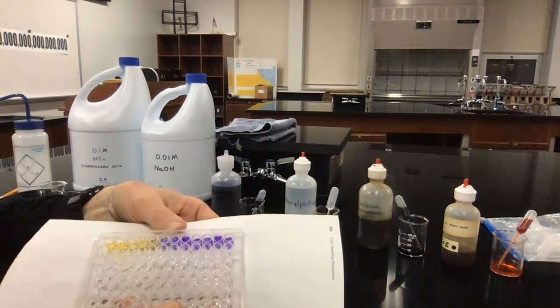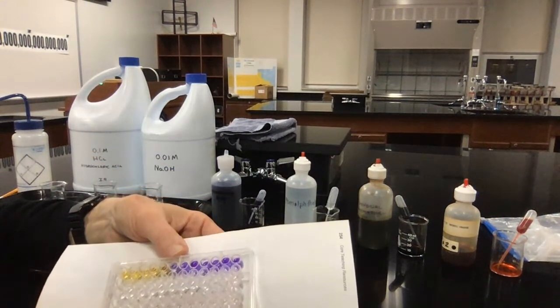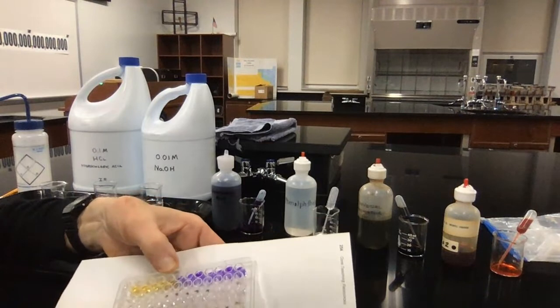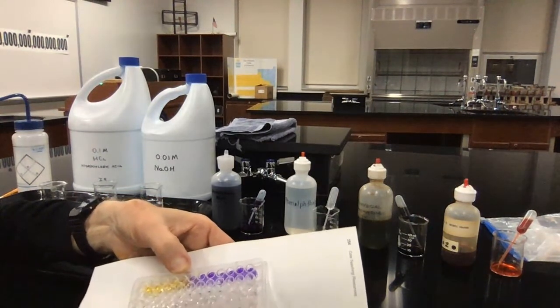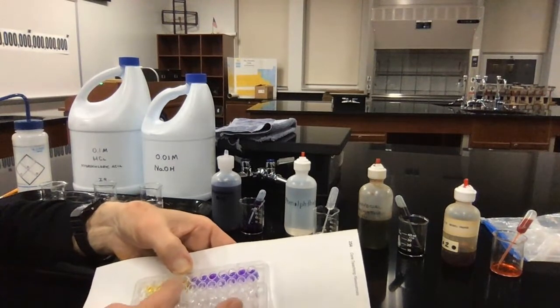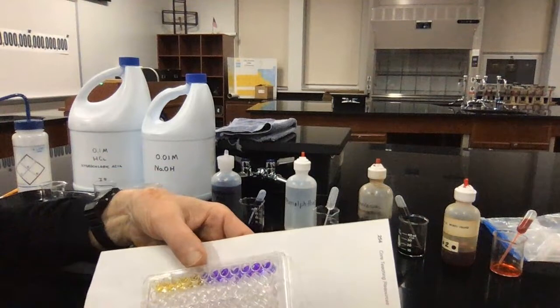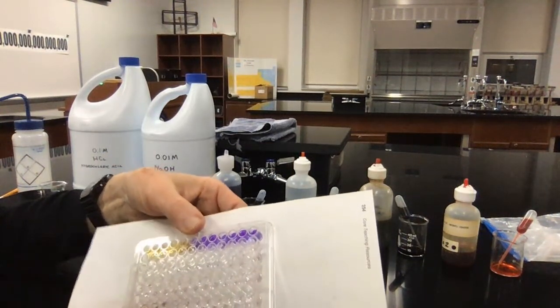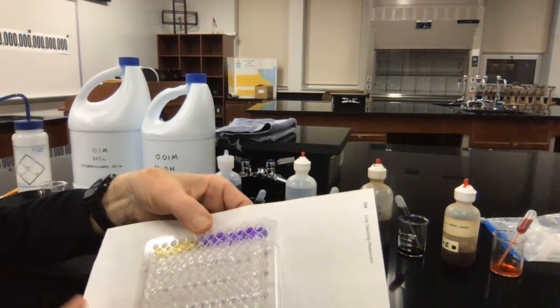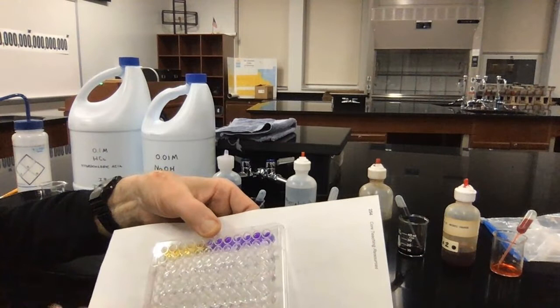My liquids change in their color and also in the intensity of their color. And right about in here, there's a drastic switch of the yellow into the blue or purple color. And that is happening at a pH of between 5 and 6. So I'm going to continue. I'm going to put the video in pause right now, and then I'm going to continue with my next batch of indicators, and I'll come back.